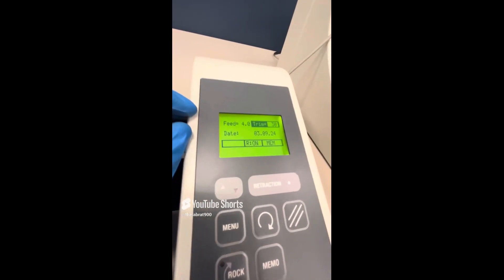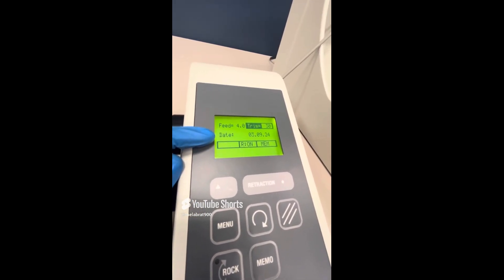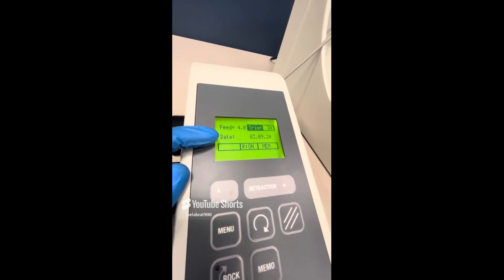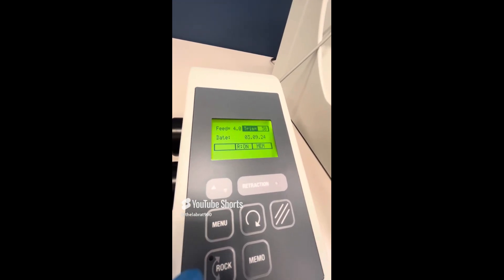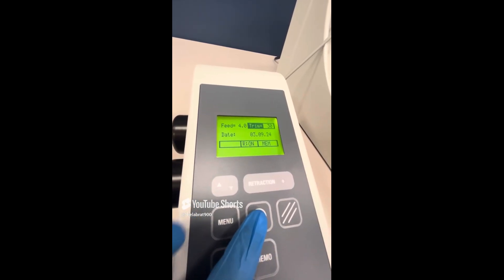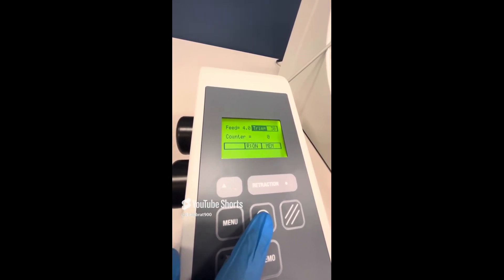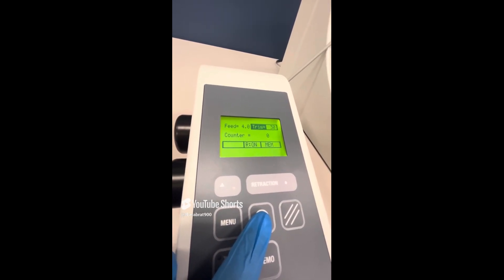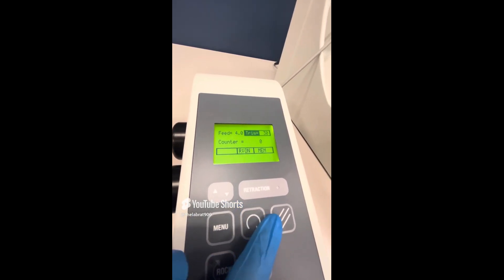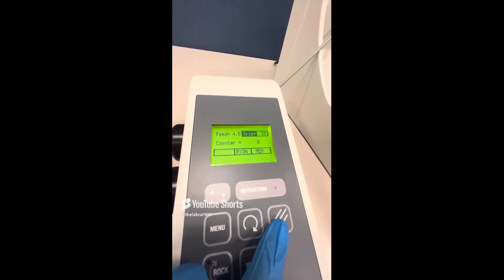The second line shows a couple of different things. Press this button to switch between them. First is the date. Then you'll see a counter, which shows the number of sections that were produced — you can reset the counter by pressing this button here. It's zero so there's nothing to reset.